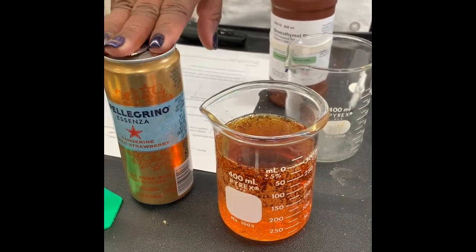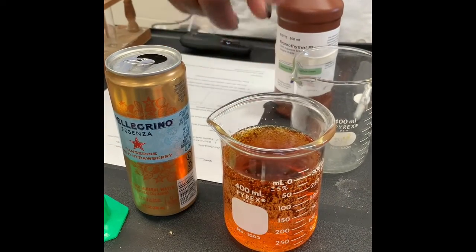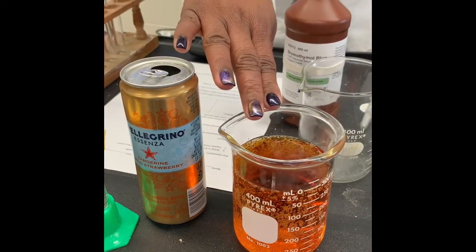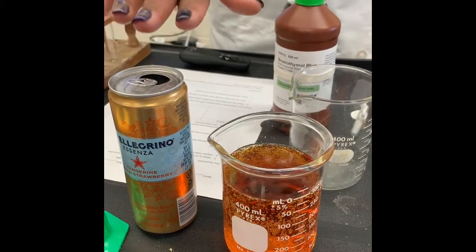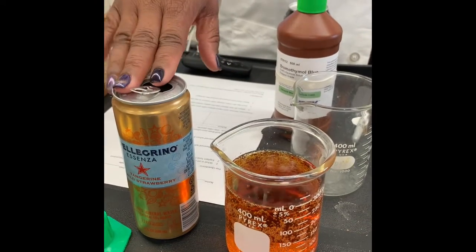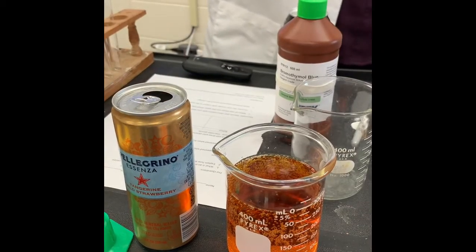You're correct. It changed in the face of an acid. And if this is an acid, which made it change from that blue to a yellow color, this BTB indicator means that this is in fact an acid. So that means its pH is less than 7. Less than 7. Good.